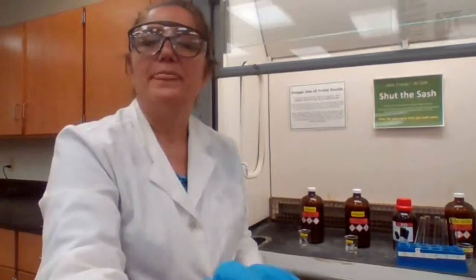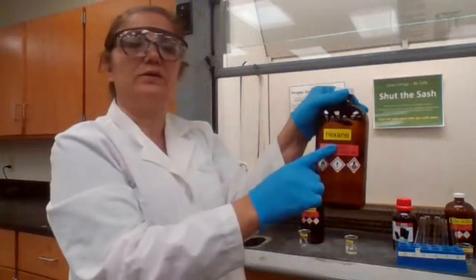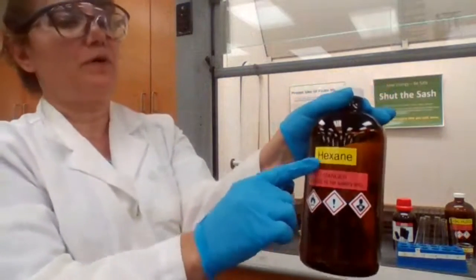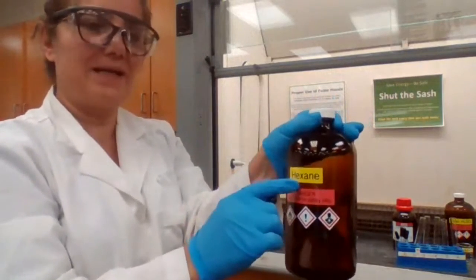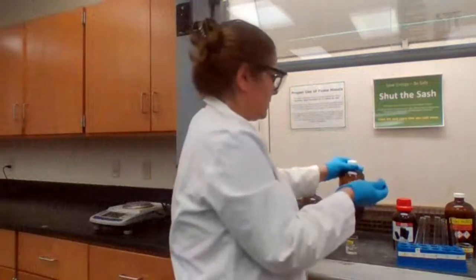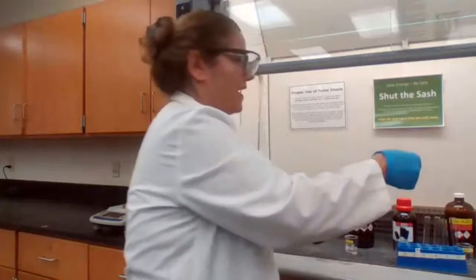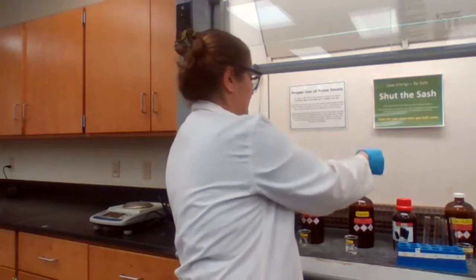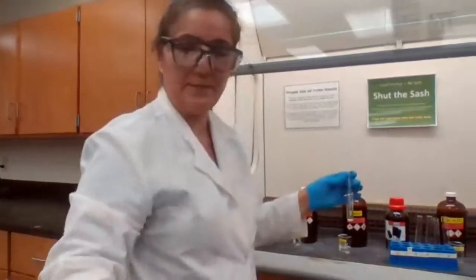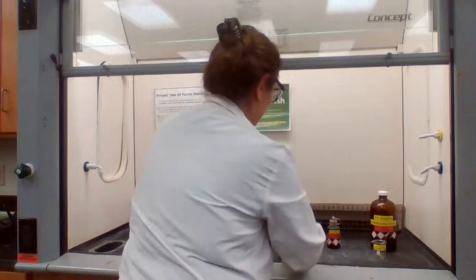1 milliliter of sulfuric acid, 5 drops of hydrocarbon. The first hydrocarbon that I chose is hexane. So you can record in your lab notebook. We are testing now for hexane. That's the first hydrocarbon, hexane plus sulfuric acid, and I show you the result. So I'm taking 5 drops of hexane. That didn't go very well, but 5 drops of hexane and 1 milliliter of sulfuric acid.